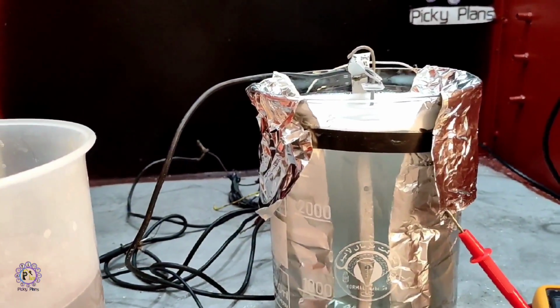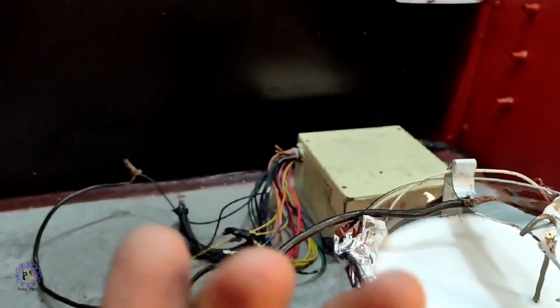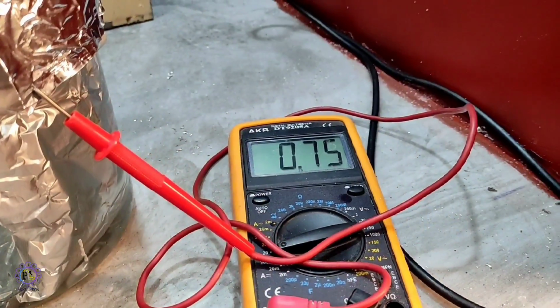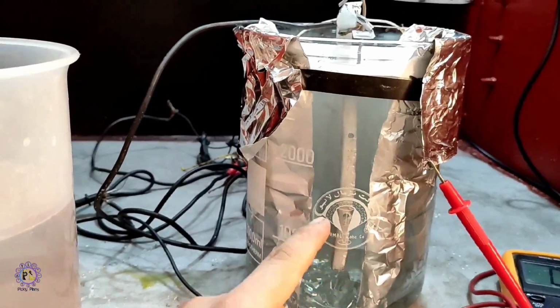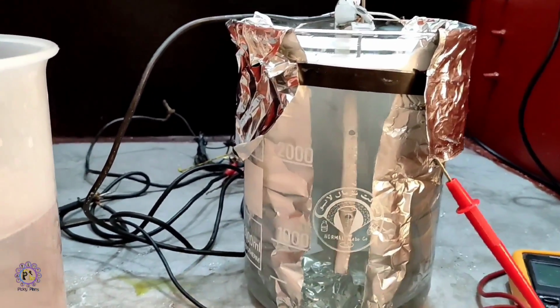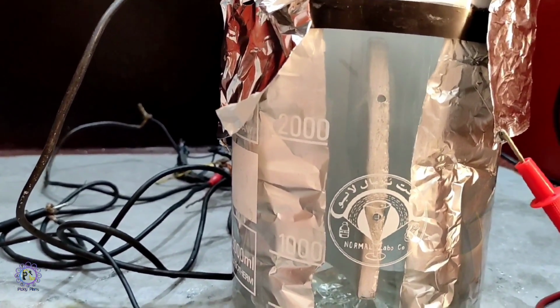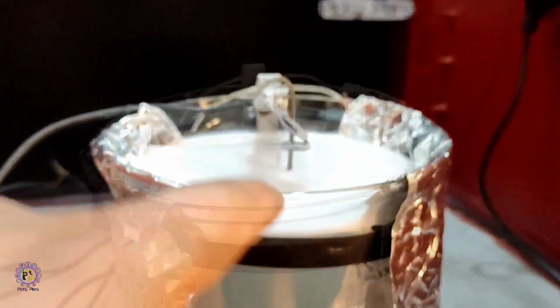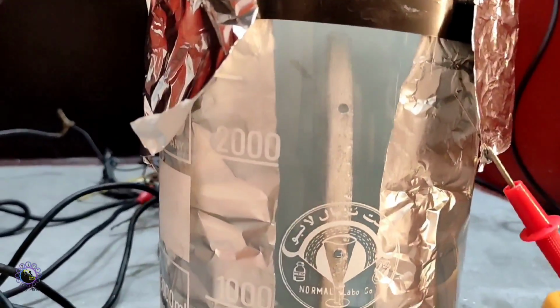The front lid of the power supply is being anodized, and you can see I'm just using a simple computer power supply, and the current is about 0.75 amps, which is enough for this surface area to be anodized in about 45 minutes to 1 hour. And you can see the bubbles are coming out. I added some non-ionic surfactant to give a better anodizing on the surface and break the bubbles.